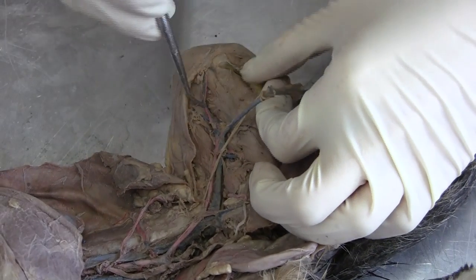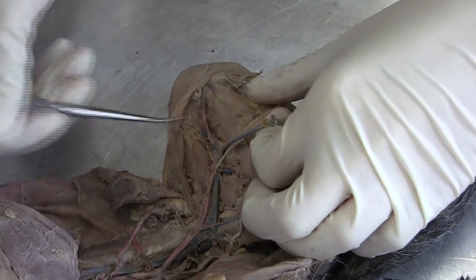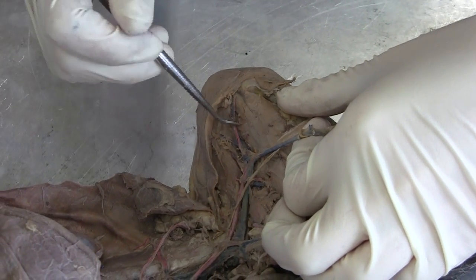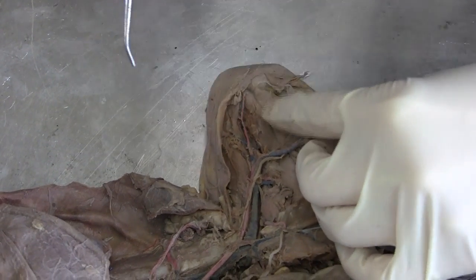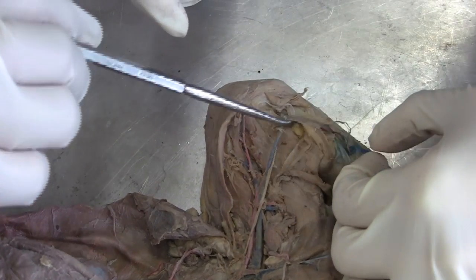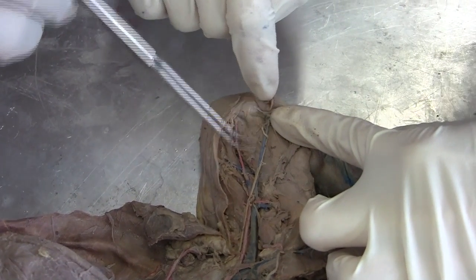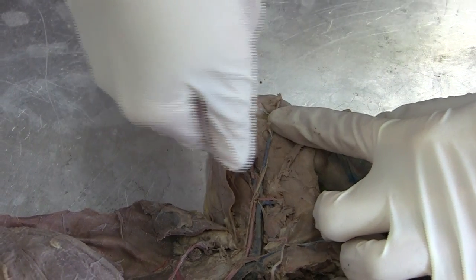And the popliteal artery is underneath. I thought the saphenous went upwards towards the kneecap — yeah, it's underneath. You can keep going — that's the popliteal artery. In his cat it looks like the saphenous is kind of attached with this one, and the popliteal is underneath. And this is the common iliac vein — this one is the external, and underneath there is the internal. You cannot really see it.